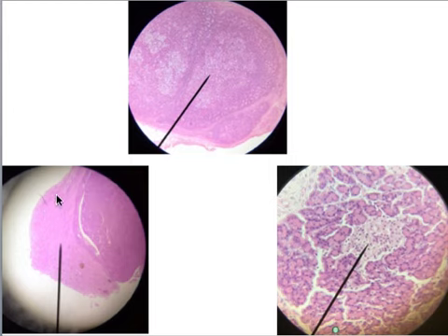The posterior pituitary gland, on the other hand, is just a storage facility because the hormones that this portion releases are secreted by the hypothalamus, sent down the infundibulum, and they are just going to be stored here. So this is a little less dense. Looks like there's a lot more open space to store those two hormones.